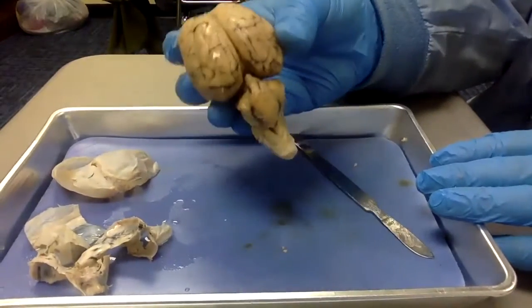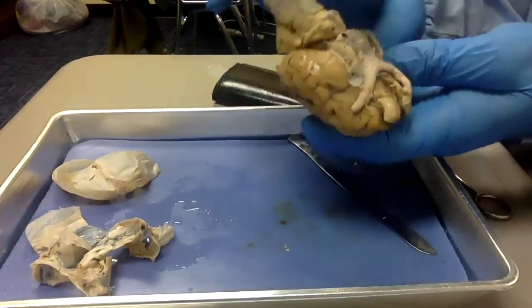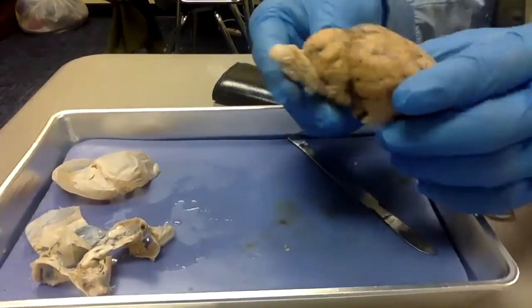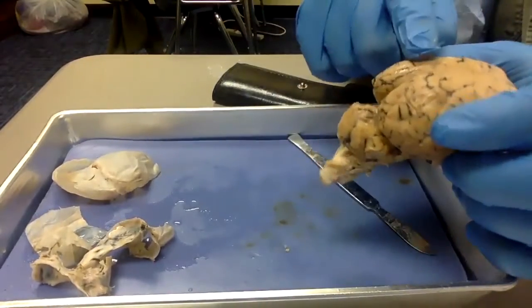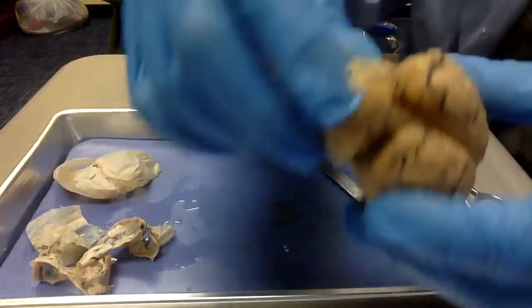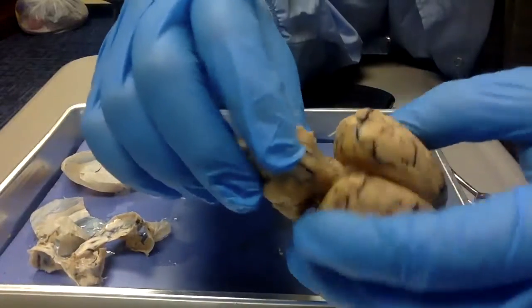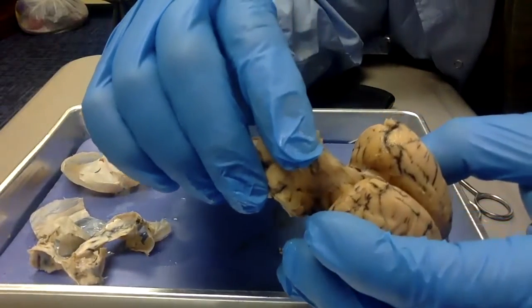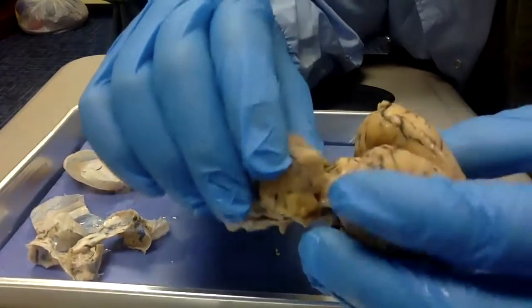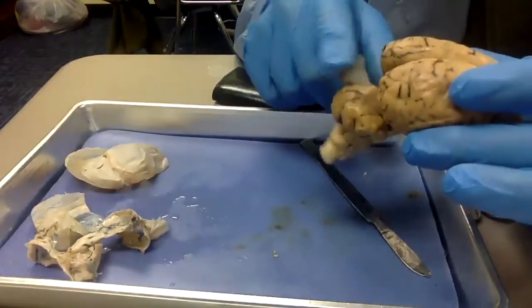And here we have the entire exposed brain with a little bit of the dura mater still on the bottom so I can hold on to those optic nerves. Not that I need them anymore. And again, first thing I showed you before was the cerebrum and the cerebellum are not actually attached to each other. You can see some pia mater still trying to hold it in place. That's actually going to rip as I pull it. That goes like webbing, right? That's just the epithelial covering. I didn't actually rip any brain. All right, so you see that they're not actually attached to each other.